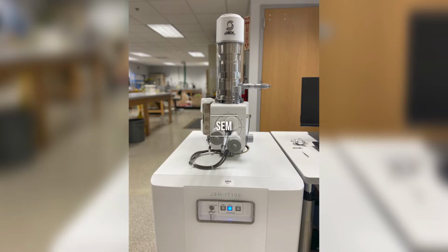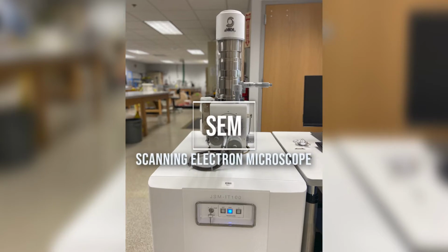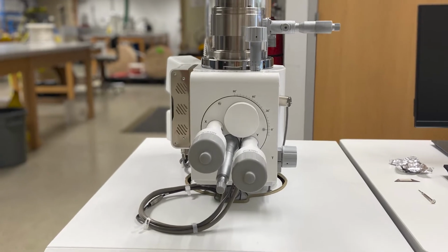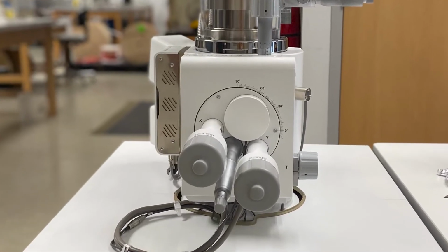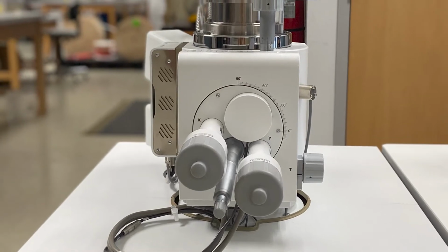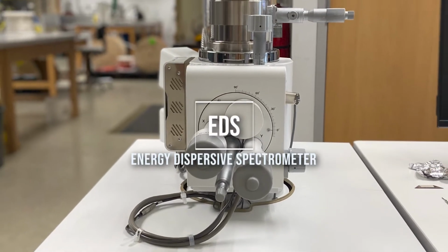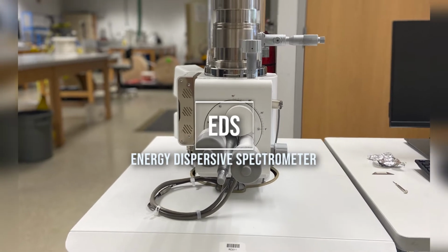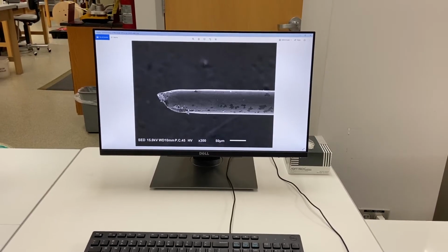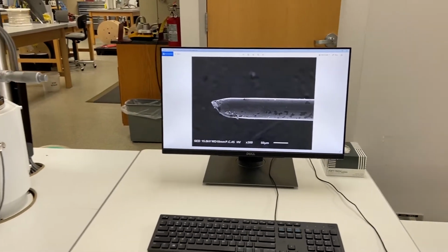Let's take a look. The Scanning Electron Microscope, or SEM, enables observation of samples at far higher magnification than is possible with optical microscopy. The SEM is also equipped with an energy dispersive spectrometer, or EDS. The EDS uses characteristic X-ray emissions to indicate which elements are present in the sample and their relative amounts.